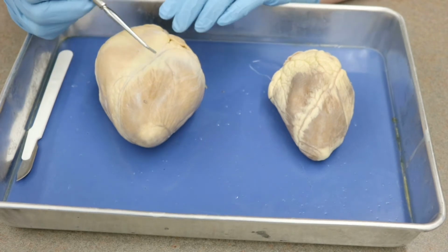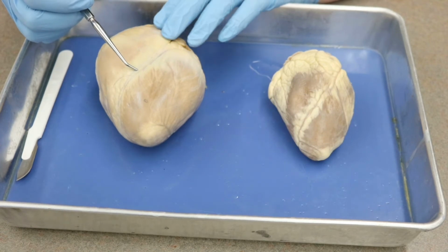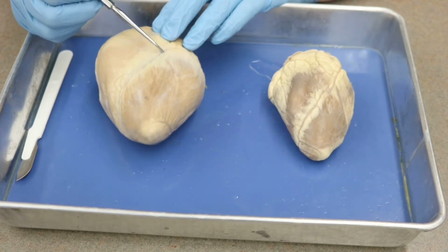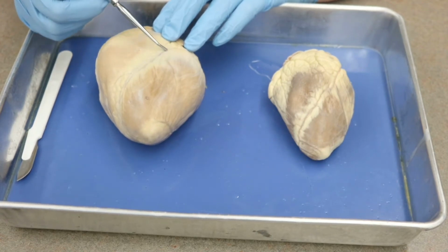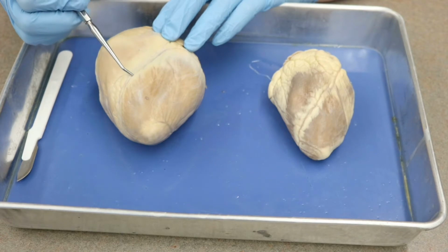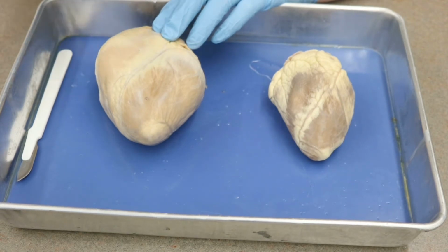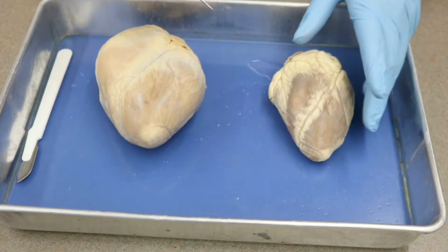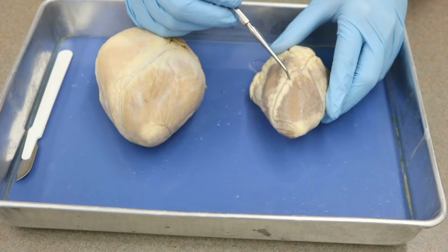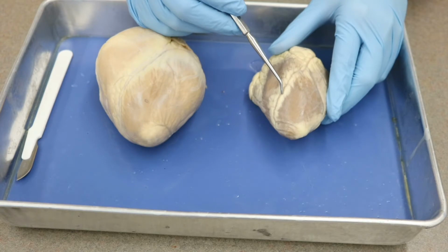It allows the blood vessels to run in them. So we would have a number of blood vessels here. We don't really need to know them for the dissected heart, merely because, well, they're not here. So on a model, though, you would need to know the anterior interventricular artery and the anterior interventricular vein would be running around in this area. But if you're looking at a dissected specimen, this would just be the sulcus. Similarly, on the sheep heart, we can see running right here, we have our anterior interventricular sulcus.